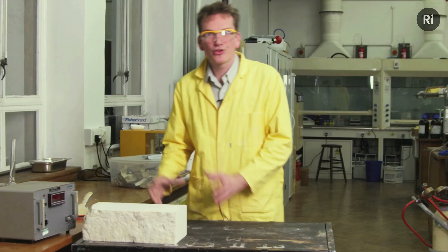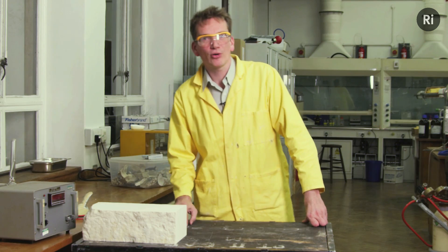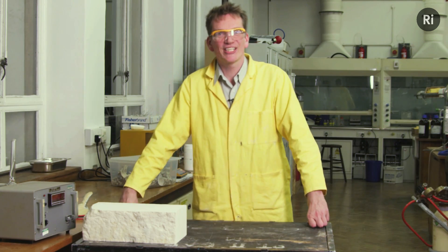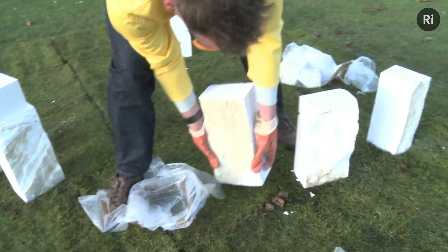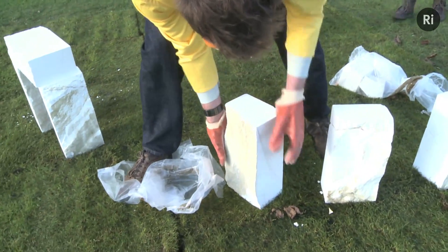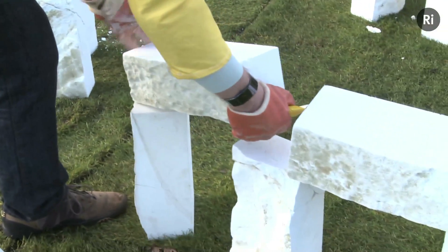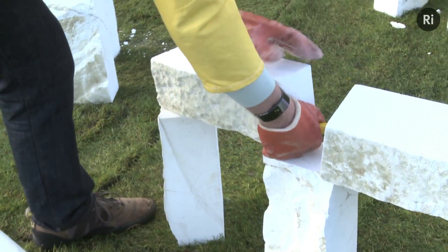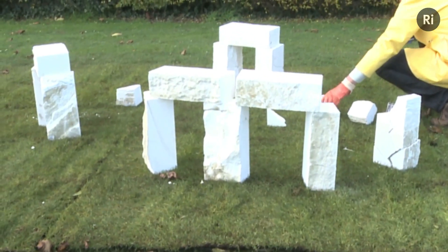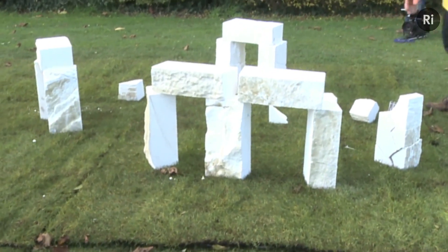Because we've driven out all of the carbon dioxide from this rock, it's actually lost quite a lot of its weight. But it's also changed in structure, and we're now going to see why it is that you won't find any buildings made out of calcium oxide.